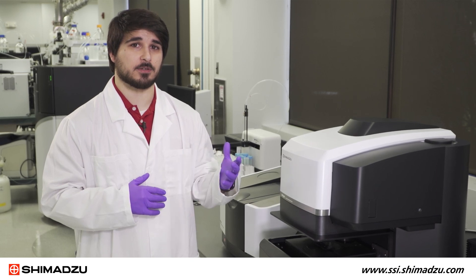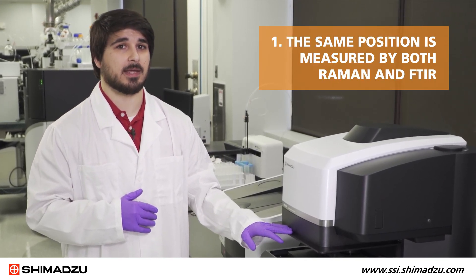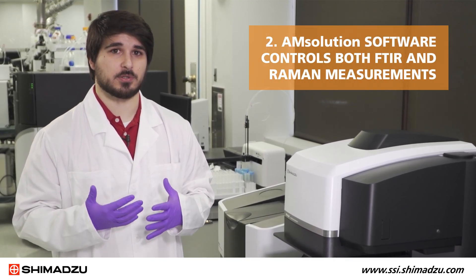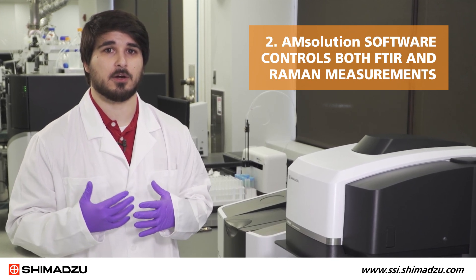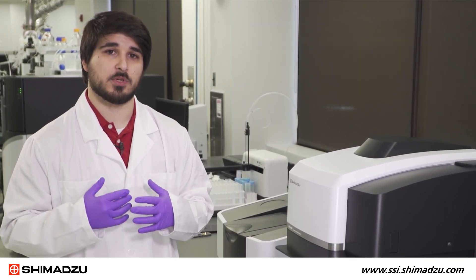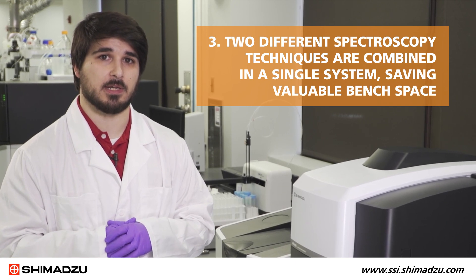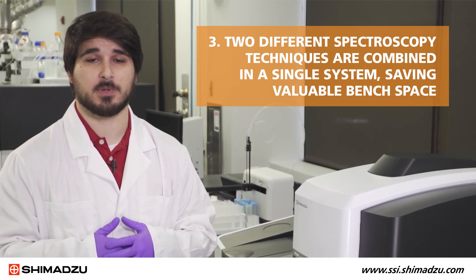The three important takeaways about the AirSight are: the same position is measured by both Raman and FTIR; AM Solution is a smart software because it controls both the FTIR and Raman measurements, which provide proprietary spectral improvement suggestions; and two different spectroscopy techniques are combined in a single system, saving valuable bench space.